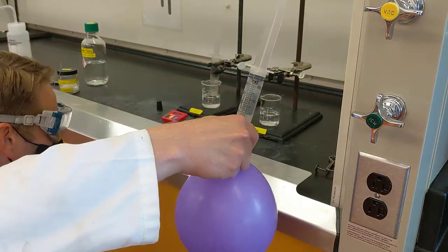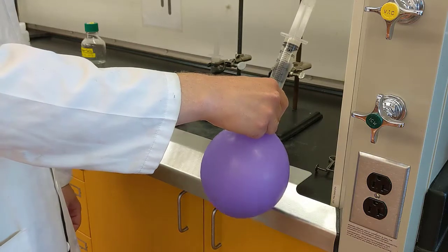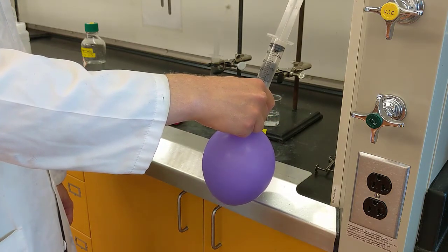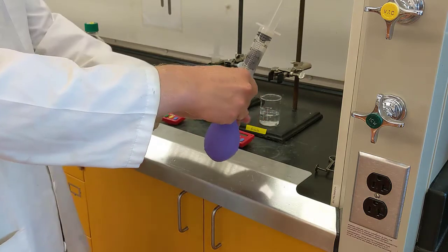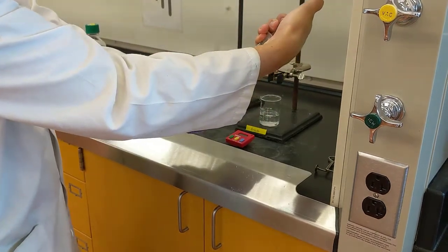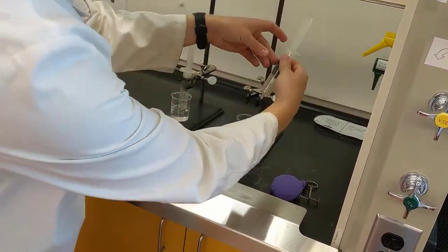The purpose of this is to push out any air from the room. We want the inside contents of the syringe to only be exhaled air, which is why we're using a pretty big balloon here. It may take a minute or two for this air to go through, but just be patient. When you're done, push the syringe back down so that the hole is no longer open. This is very important, otherwise room air will get back in.